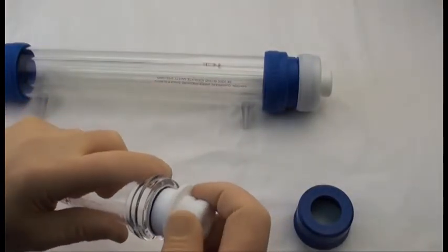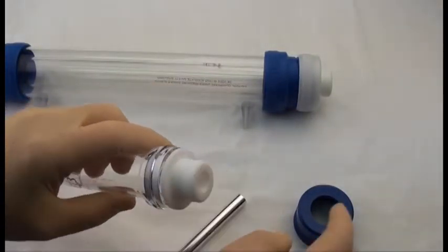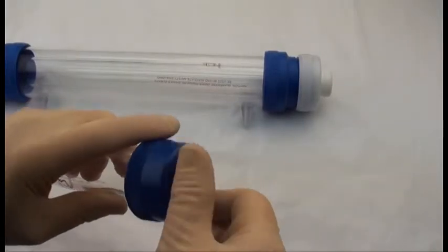Once you've done that, just place the end fitting back into the column and replace the screw cap.